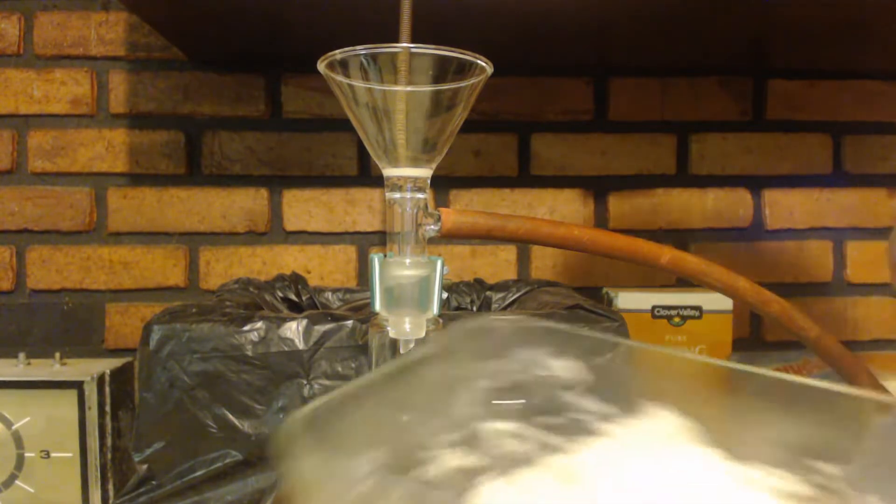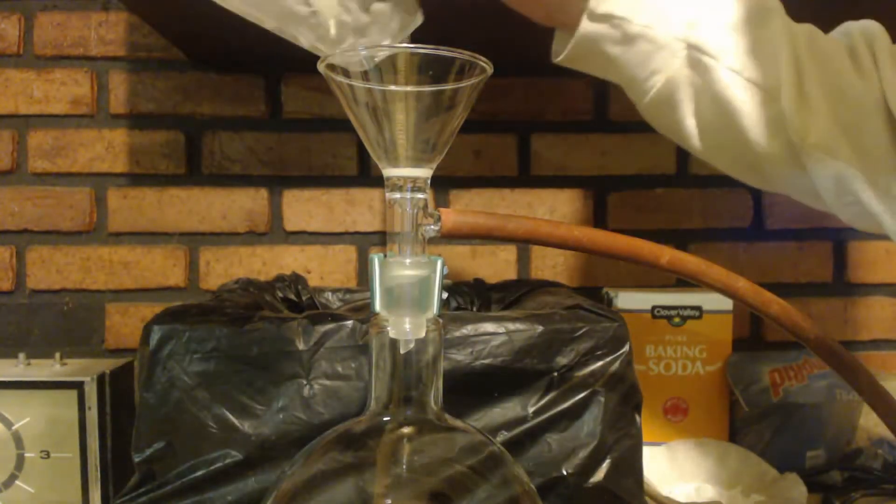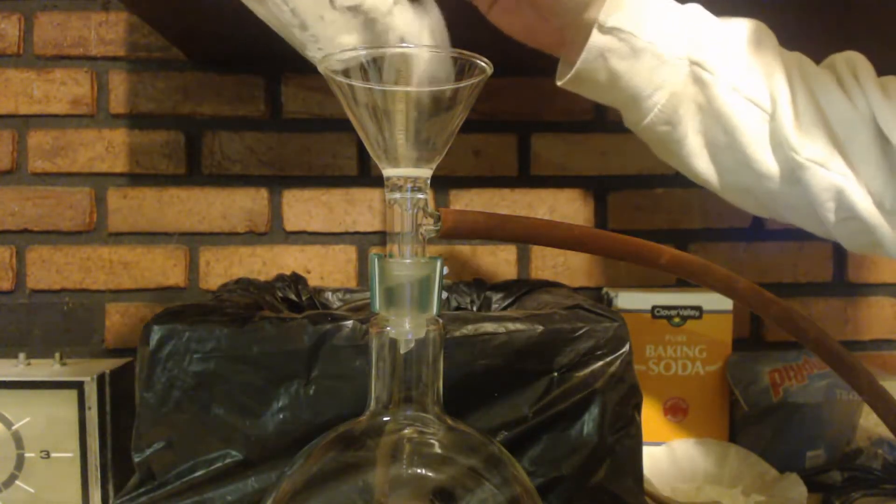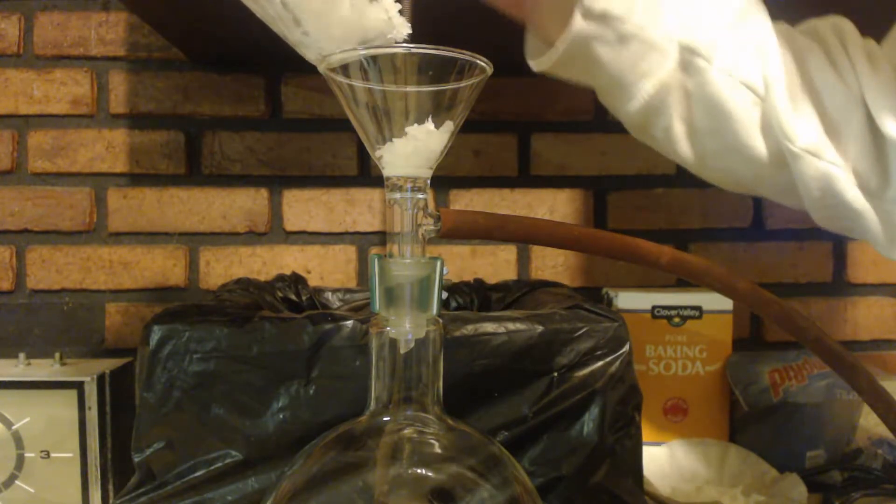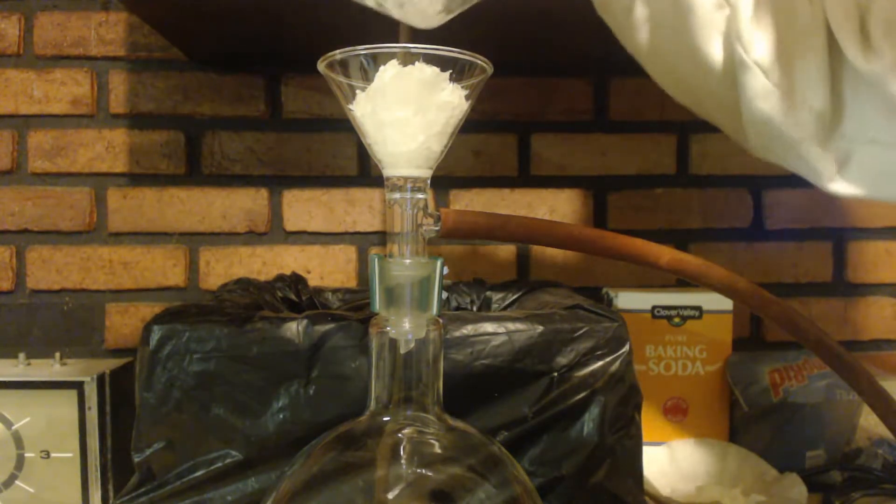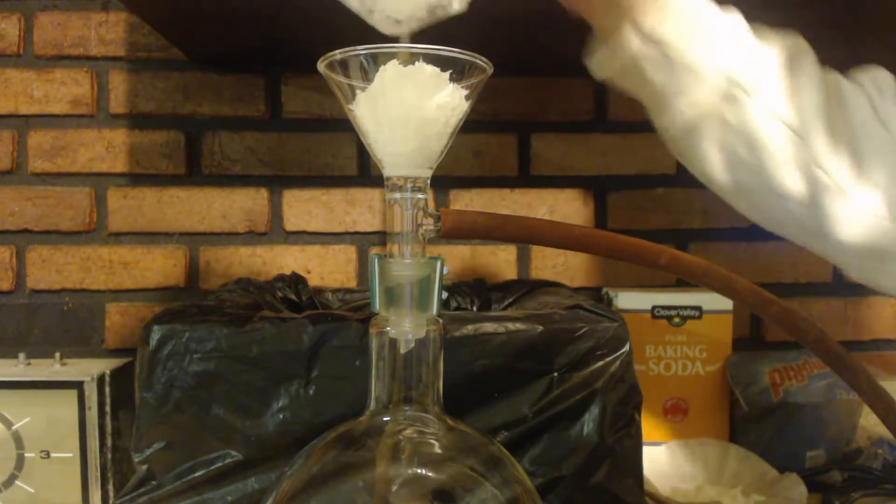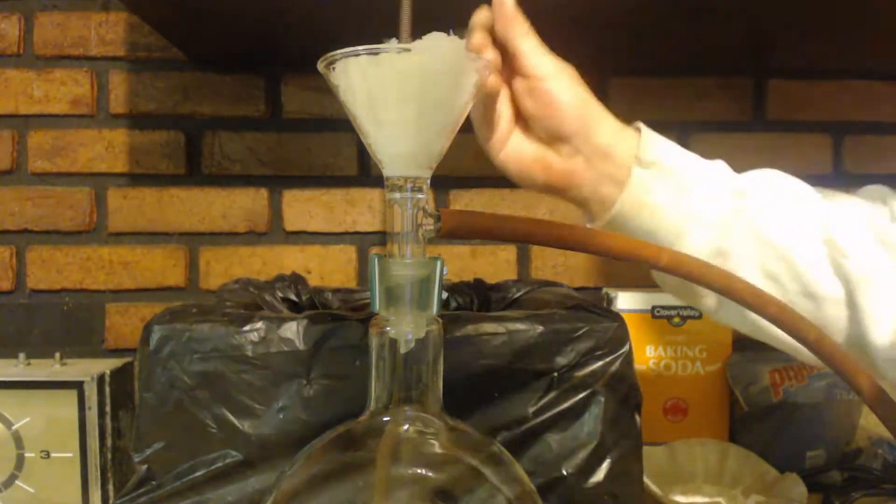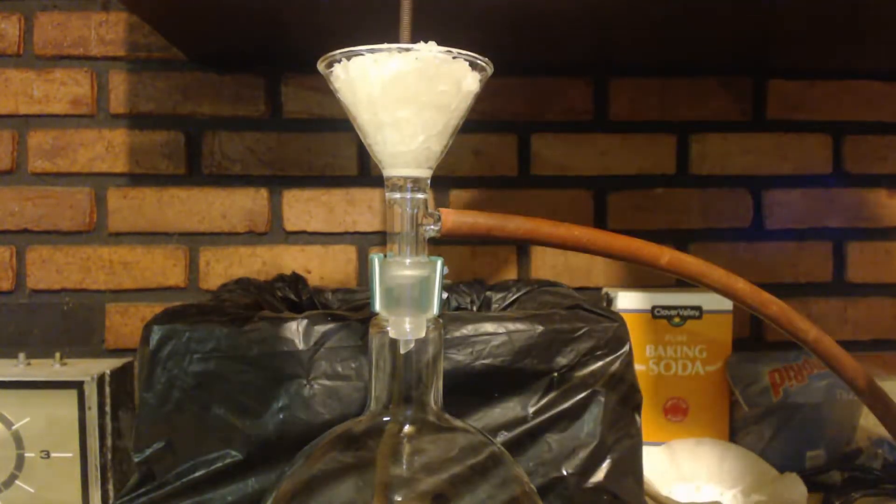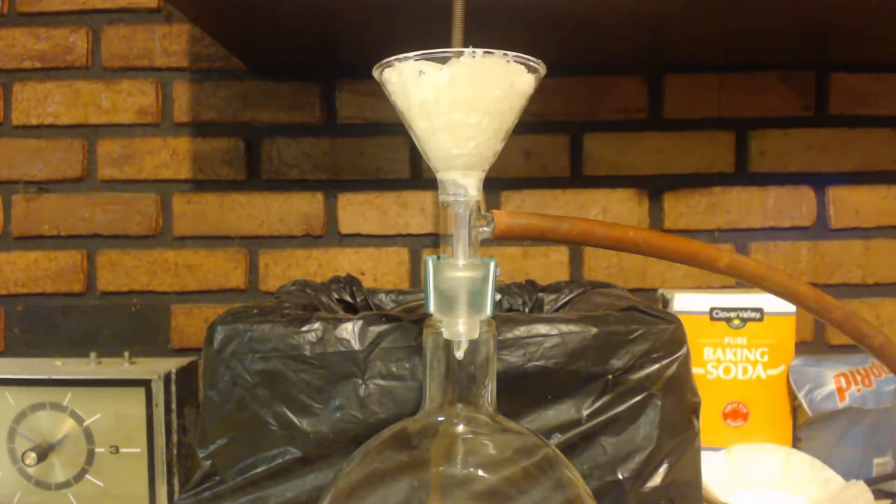No matter what I do, it seems like the more it dries out, the more it soaks up water from the air. So I put it in the freezer, chill it down. I want to suck it dry with this vacuum pump and then I'm just gonna weigh it.